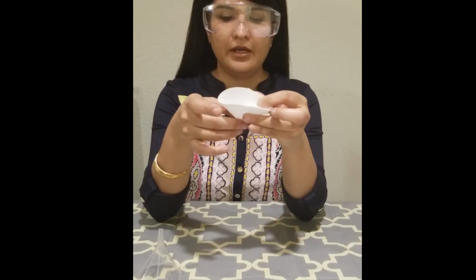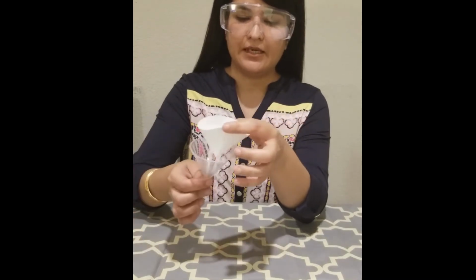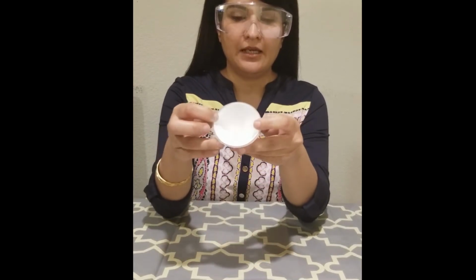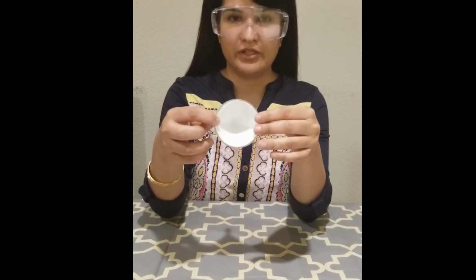Okay, so you can see that when you open it this way, it is closed all the sides inside, right? It is closed all over, and you can just stick this inside this funnel, and when we transfer the mixture of liquid and solid in it, all the liquid will filter through it and all the solid will trap on this filter paper.